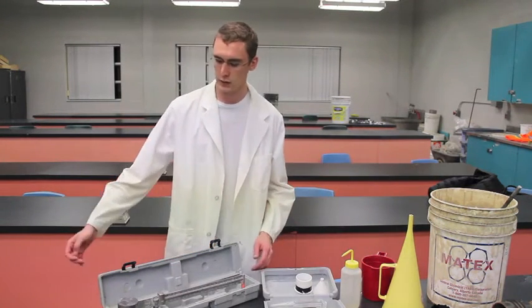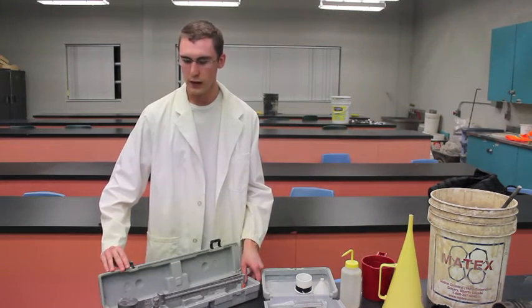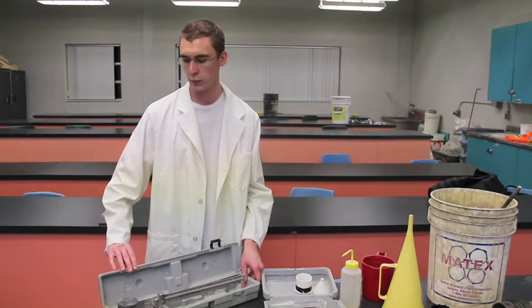One of our steps is going to be the weight and density test and we're going to use our mud balancing scale, and this is going to weigh our mud in pounds per US gallons.